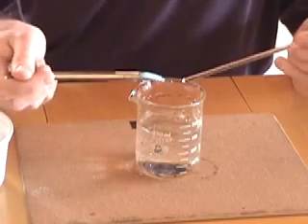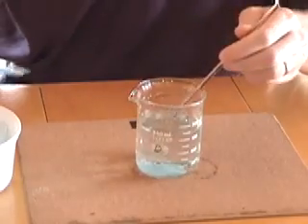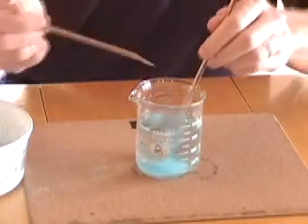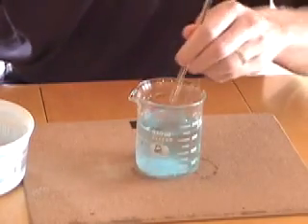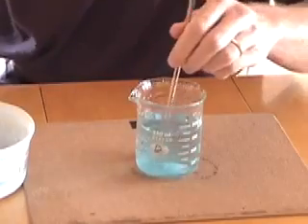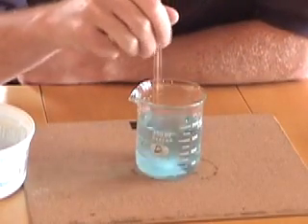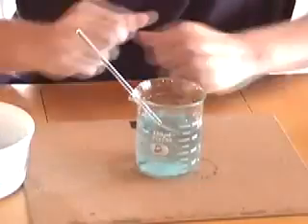Here's our old friend copper(II) sulfate being dissolved in solution, making a nice pretty blue solution. We put in some more copper(II) sulfate, and then some more, and you know the solution is unsaturated until the point where we can dissolve no more crystals at the bottom. They've all entered into solution as much as they're going to, and we have a saturated solution.